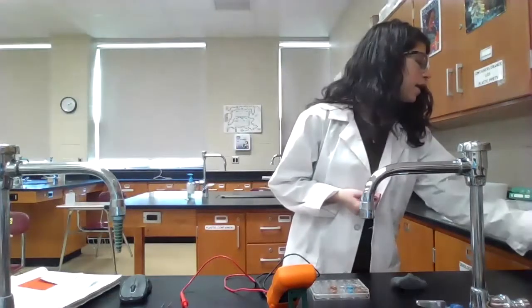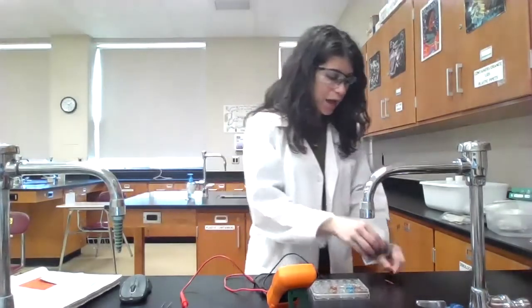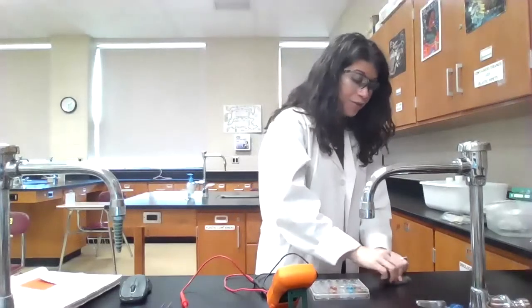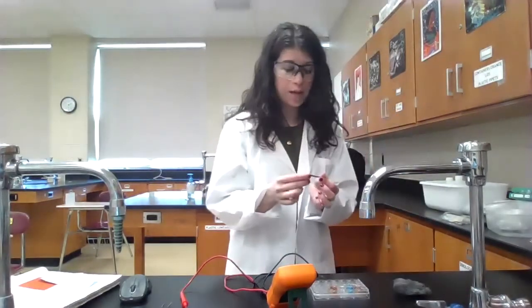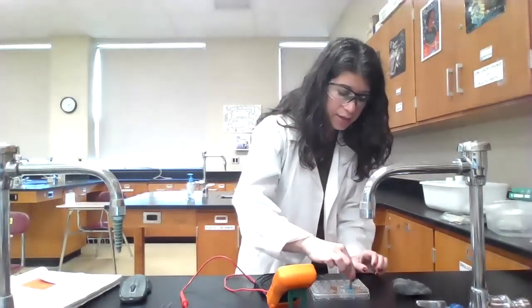So I have a little piece of copper metal and I have a piece of steel wool. So what I have to do each time is I have to rub off any potential oxidation that has occurred because this metal is exposed to the air. Different metals, of course, oxidize more or less easily, but I need to do this every single time. So now that I've cleaned off the oxidation, I'm going to go ahead and put this into the copper well.